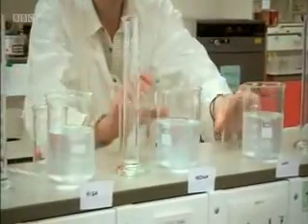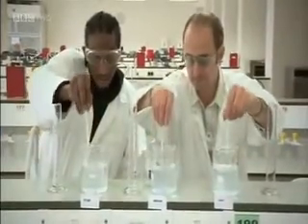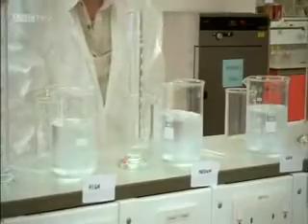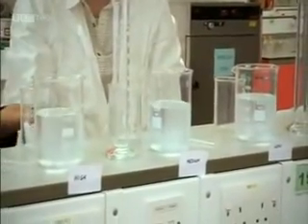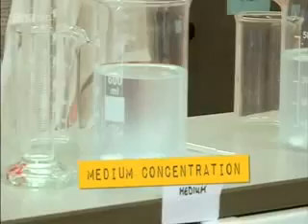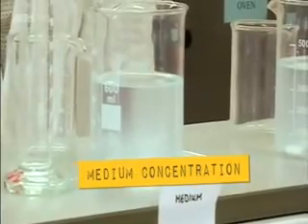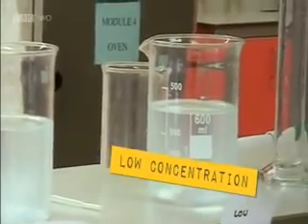Now let's just mix them up. The reaction taking place in the beaker finishes with the sudden release of iodine, which interacts with the starch that is already present to turn the solution blue almost instantly. We have the reaction going, and we're waiting for those racers to get to the end. Firm favorite is high concentration. Also in the running is medium concentration. Bringing up the rear is low concentration.